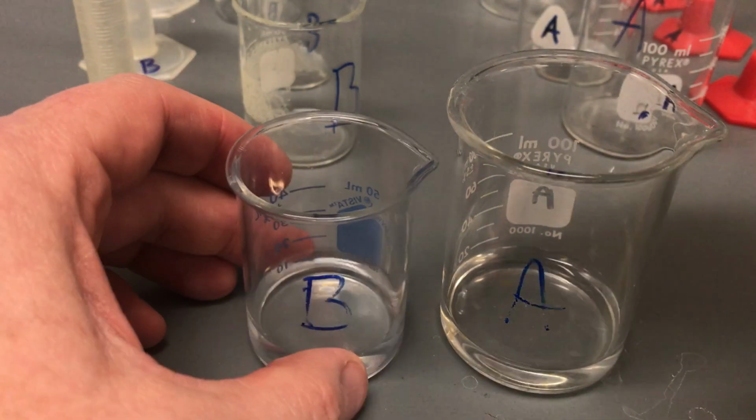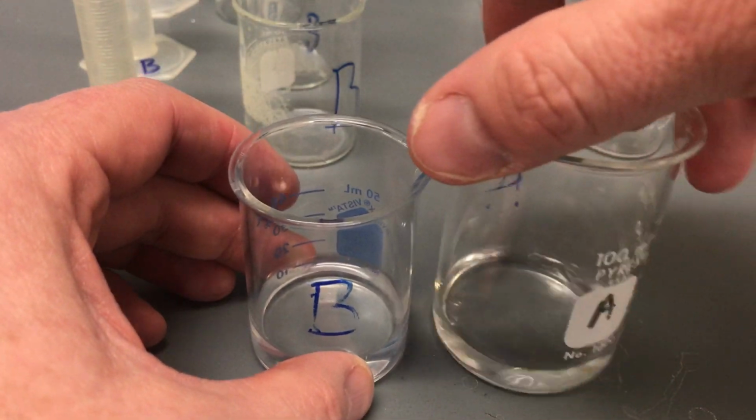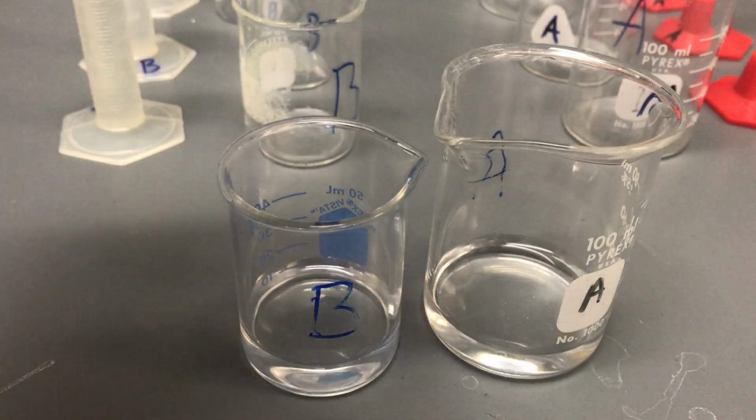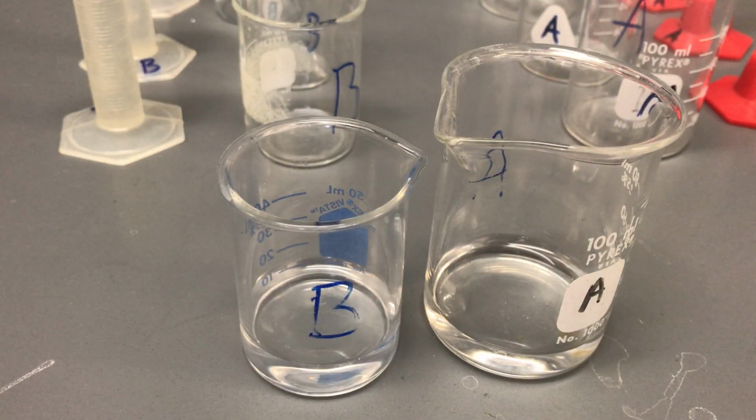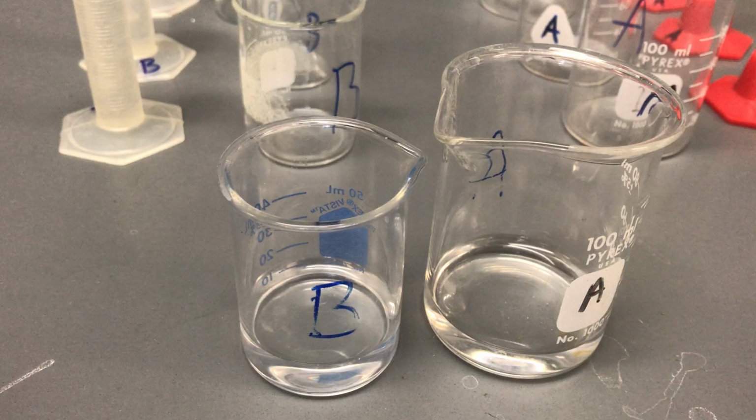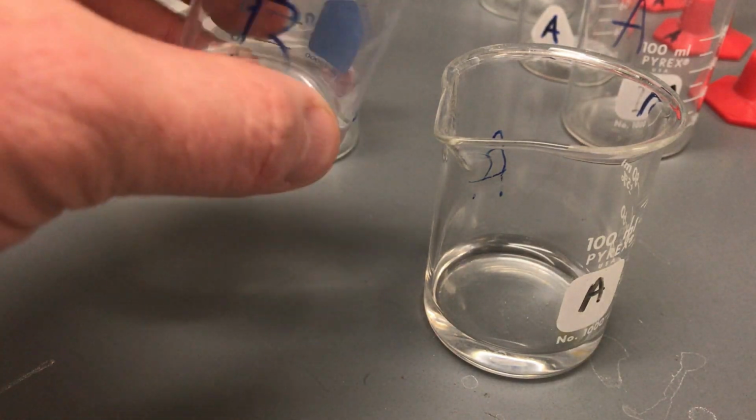So again, as soon as you see this liquid make contact with the liquid in here, then you're going to press start on your stopwatch because you're going to record the data. Maybe there's a link down below for the lab, or maybe you have the paper copy already in your hands, or maybe it's a Google form, depending on how you're actually seeing this. But as soon as you see the liquid contact, press start. As soon as you see the color change, press stop.